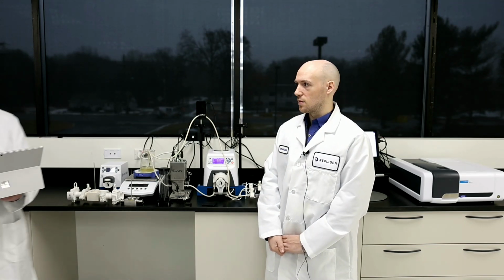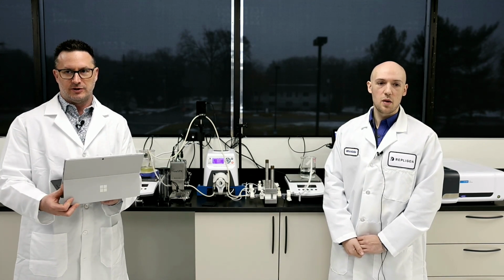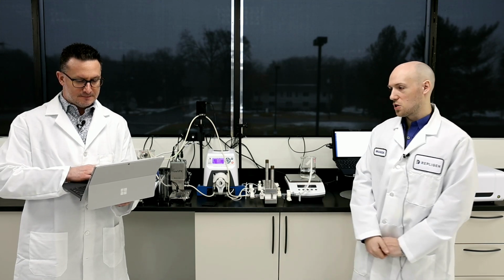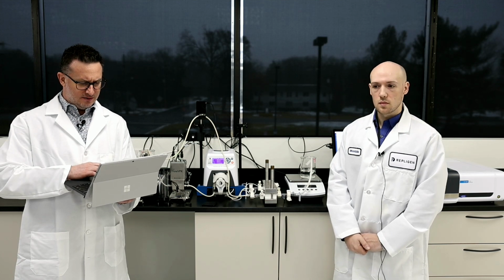But we also have other FAS experts that we work with as well. They're experts in the TFF process. So if you have any questions on those, please feel free to reach out to us, and we're more than happy to answer those for you. Yeah, and we also have the FS500, which is very similar to this system, just with a diaphragm pump that could even go larger too. Perfect, sounds great. Thanks, Brandon.